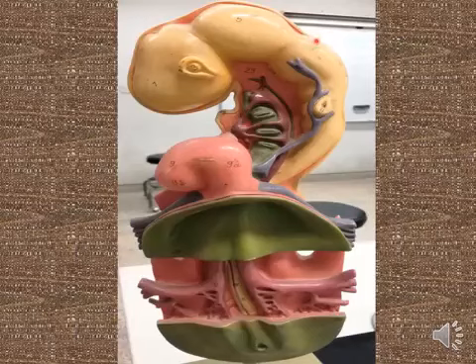And this is the rhombencephalic isthmus, the metencephalon, and the myelencephalon. This is the neuromeres of the myelencephalon. The cavity from the metencephalon and myelencephalon is the fourth ventricle. Also you can see the optic cup with lens vesicle from the diencephalon, while you can see the ear vesicle, or otic vesicle, or otocyst, from the myelencephalon.